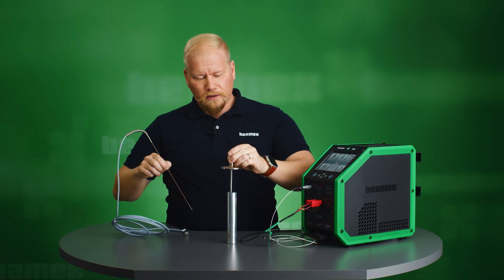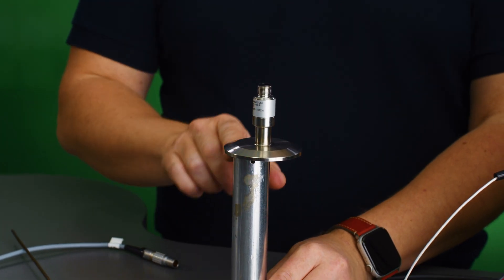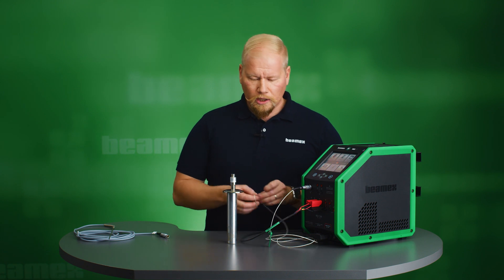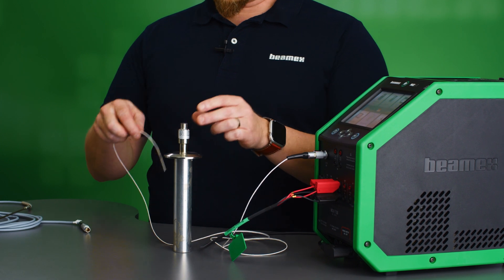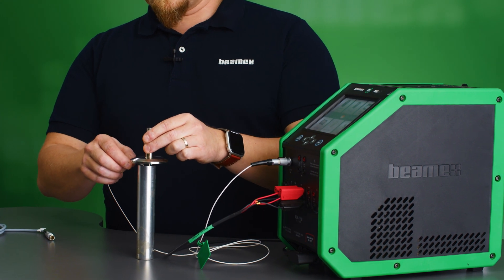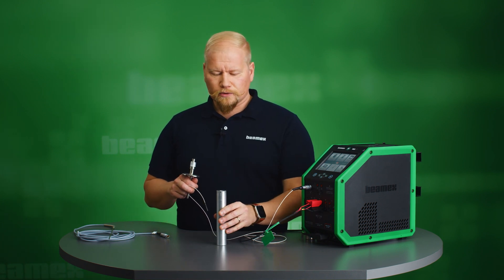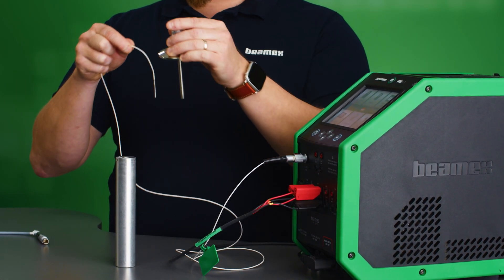When I place my short sensor on the insert, it has quite a large flange that covers all the other holes, so I cannot use this as a reference. To solve this, I need to use a short reference sensor with a flexible cable. I could place it here, but the problem is I don't know what the depth is. To solve this, I have a specially made insert with two holes — one for the instrument and one for the reference — and the holes go to the same depth.